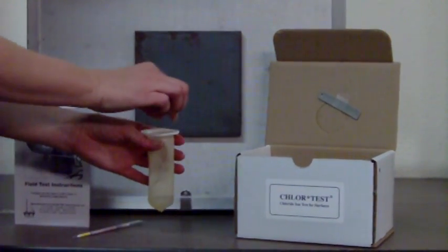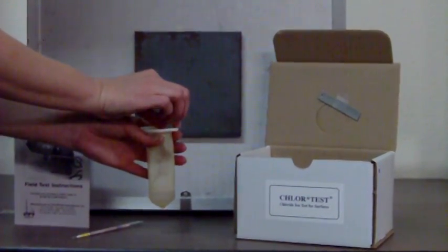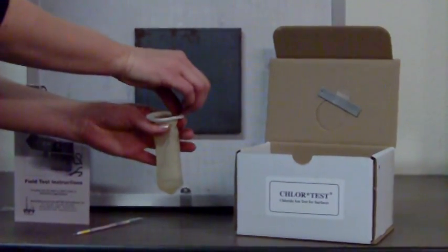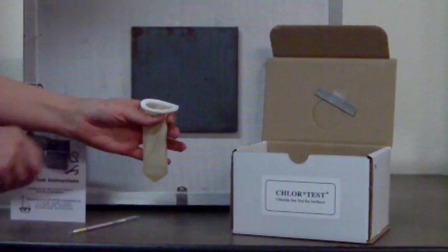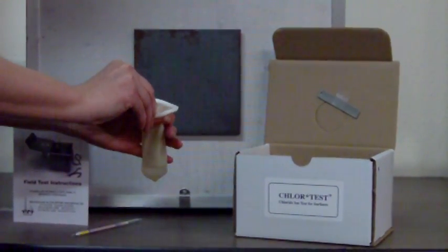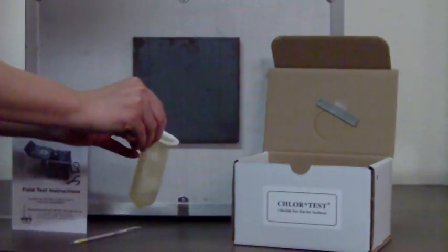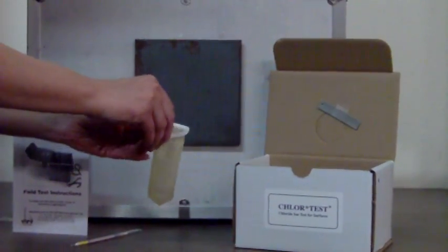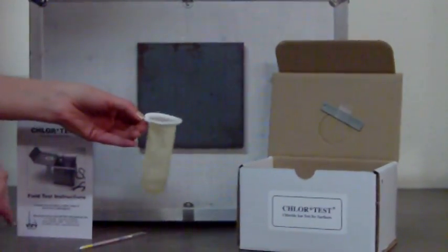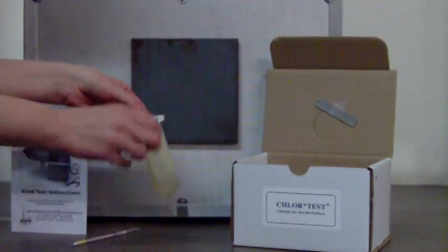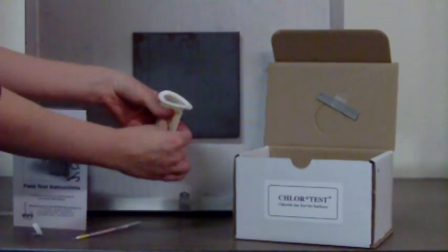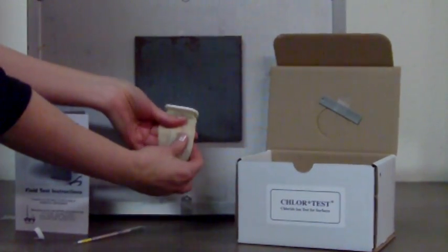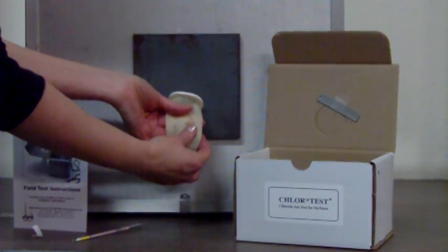Hold the sleeve between your thumb and two fingers. Peel the backing off of the adhesive. It's in two parts so it peels off of there pretty easily. Hold that between your thumb and fingers. Start at the bottom and just kind of roll it up onto the surface.